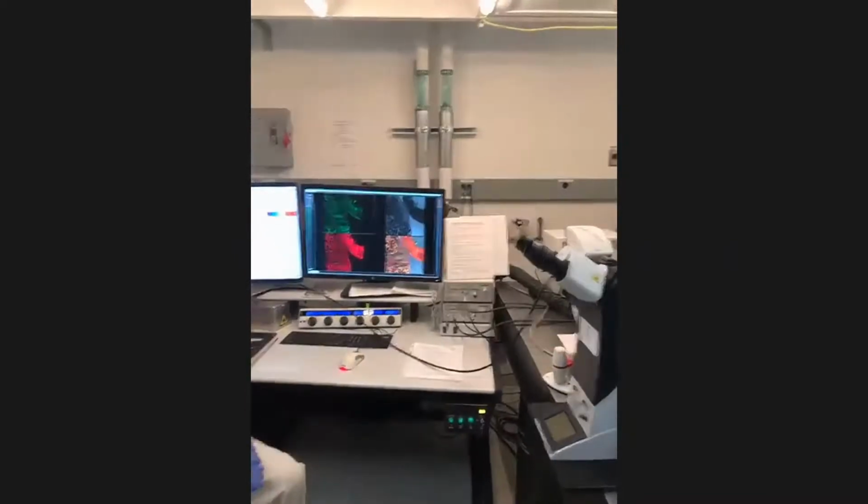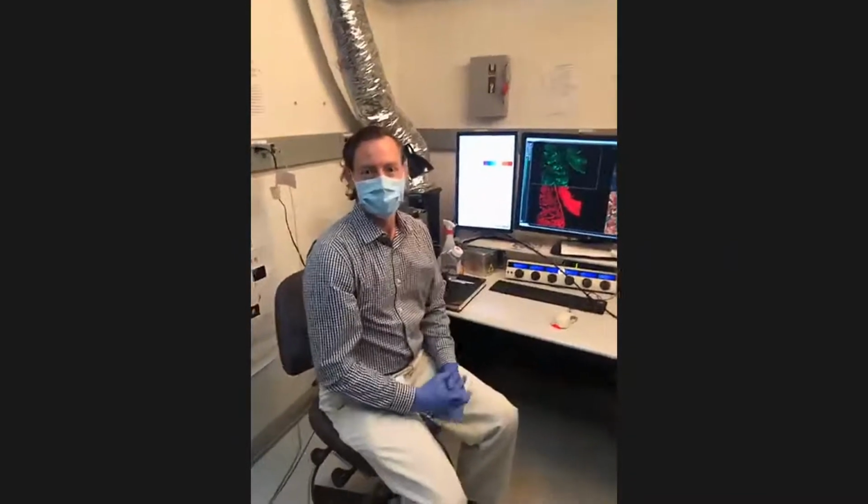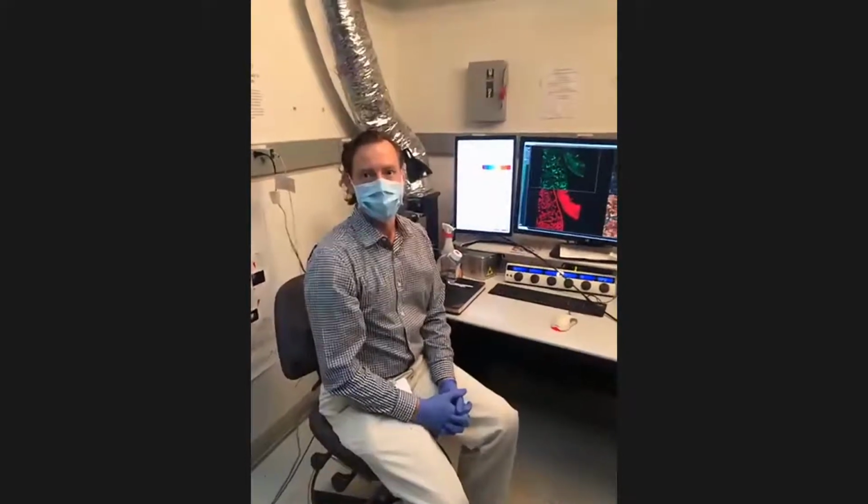So with that, I'm looking at the clock. We need to rotate over. So just also say thanks to Mike. You're going to see Mike again over at the atomic force microscope in a few minutes. Right now, we're going to walk across the hall and go see the Electron Imaging Center.